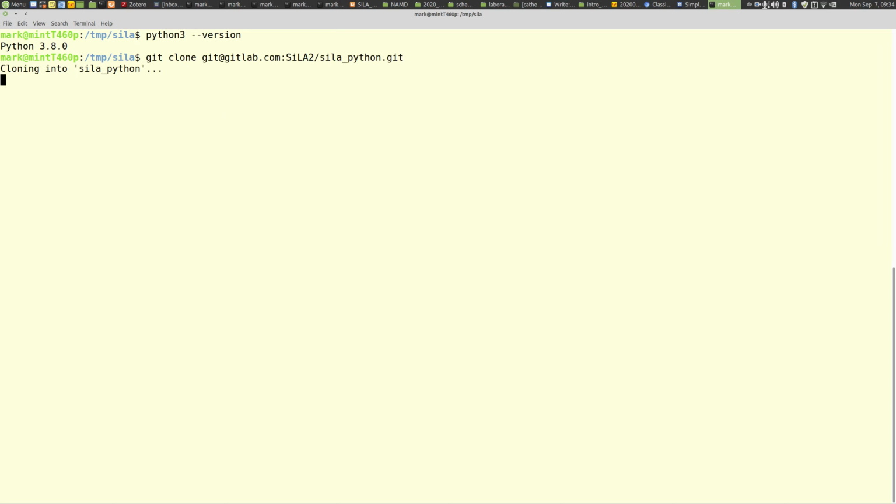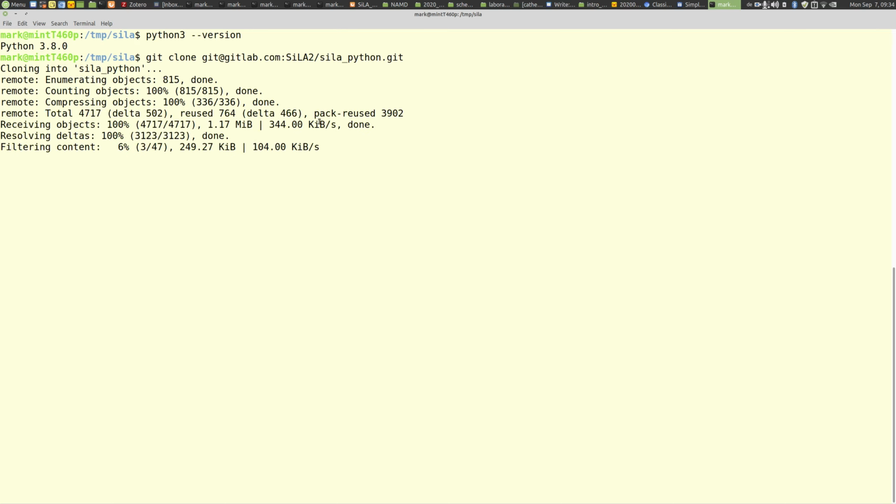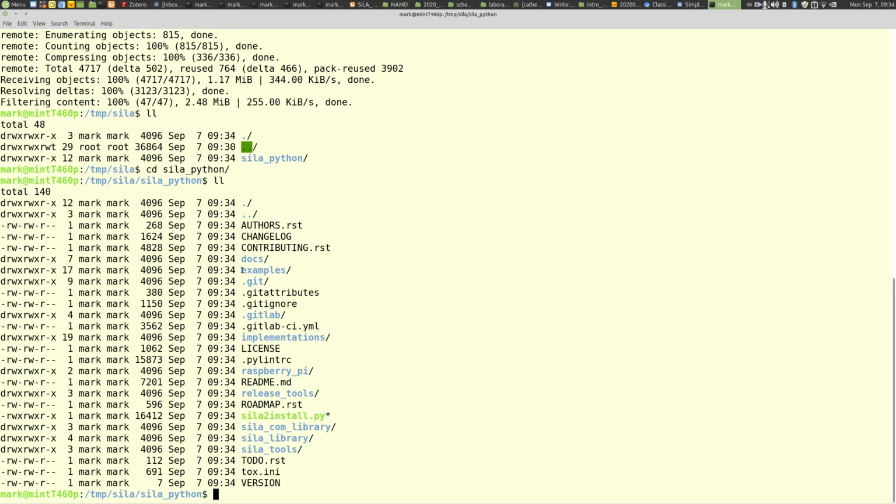like this. I have a very bad internet connection sitting at home, in home office, but you see, even if I'm very badly connected, the repository is very small and it clones in a very short time. And now we have the SiLA Python repository from GitLab. So you can go into this directory and look at it. And here is this example we would like to run. So we just do that.